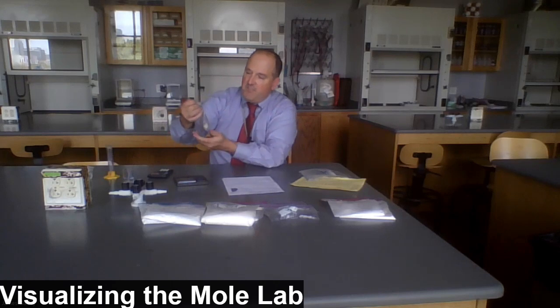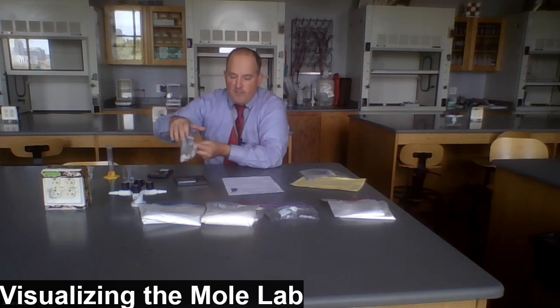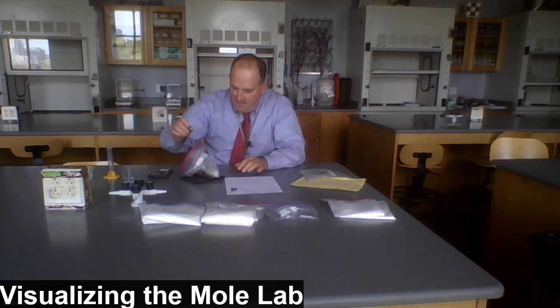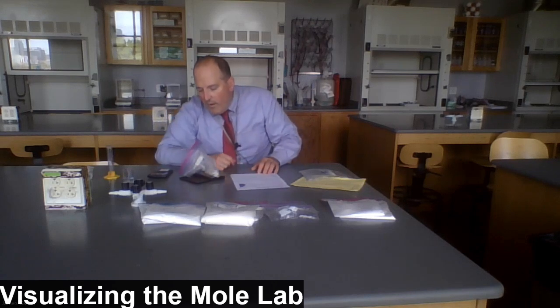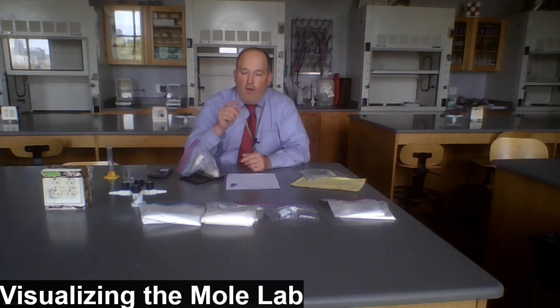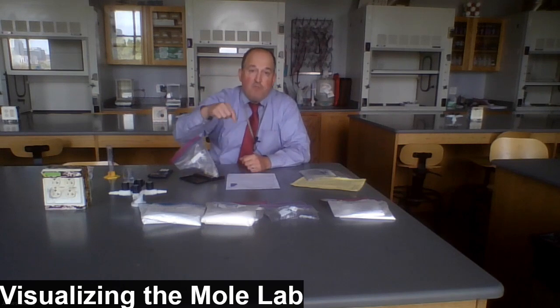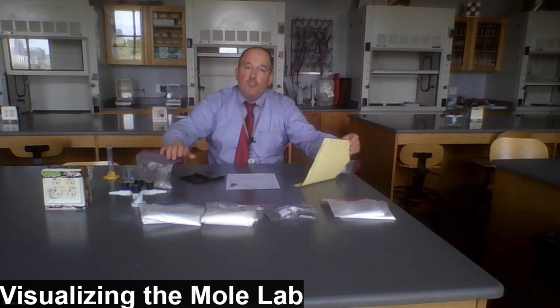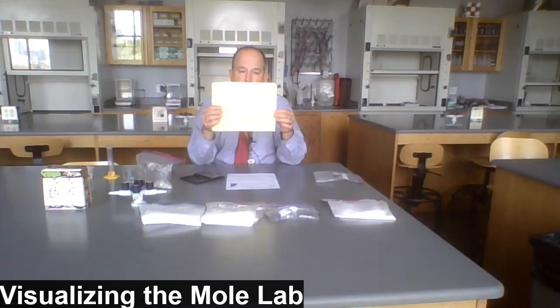And we're going to record, or at least note, the masses. So sample A is one of the two metals. And when I set it on the scale, I'm getting a reading of 124.11 grams. Now, the bag itself, the plastic bag, weighs 5 grams. So I'm going to subtract 5 from that, and I get 119 roughly, okay, grams. Now, let's look on the periodic table.